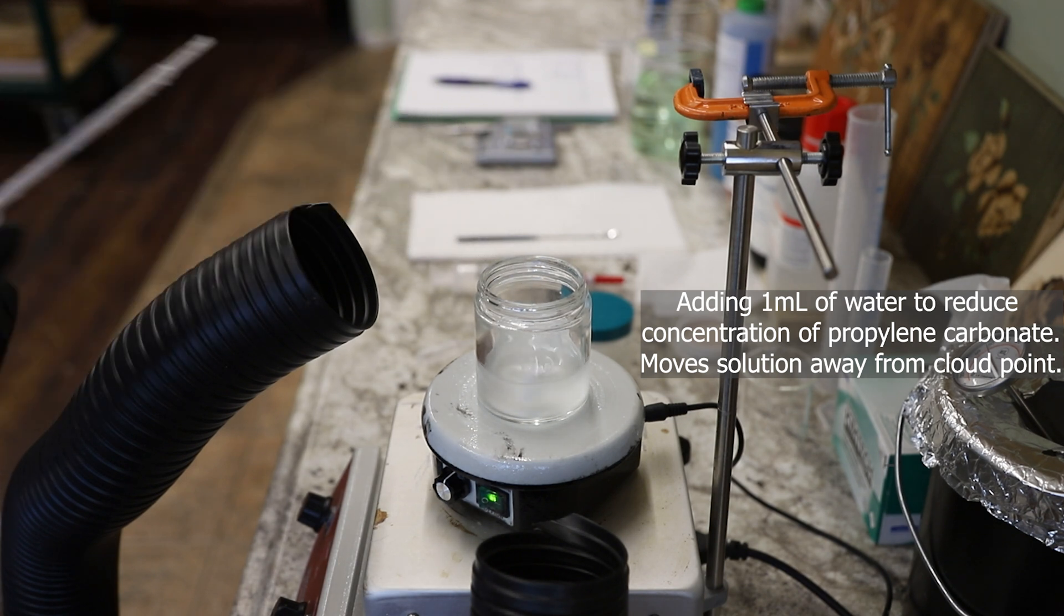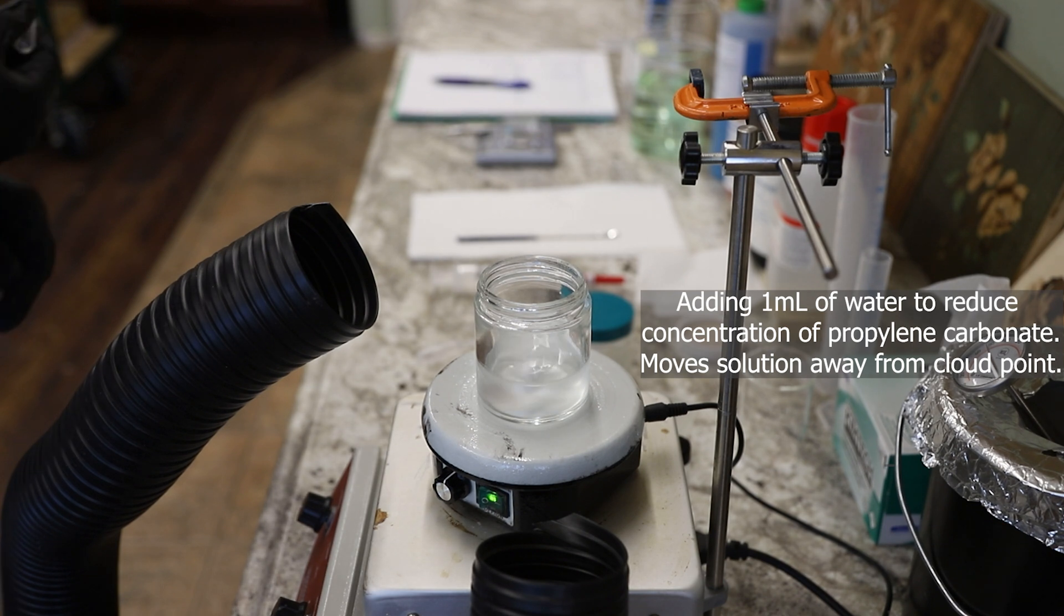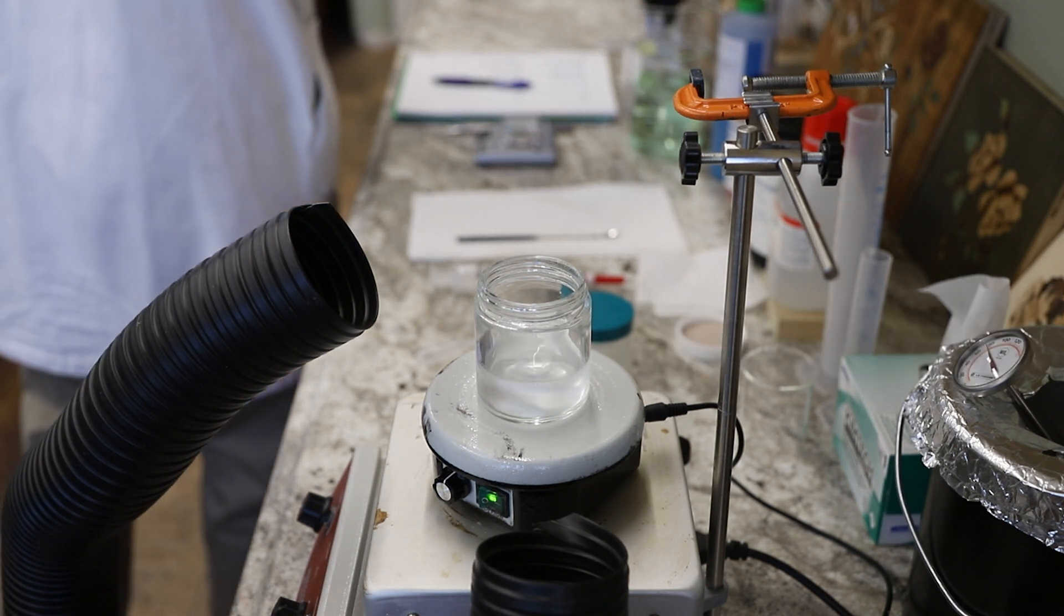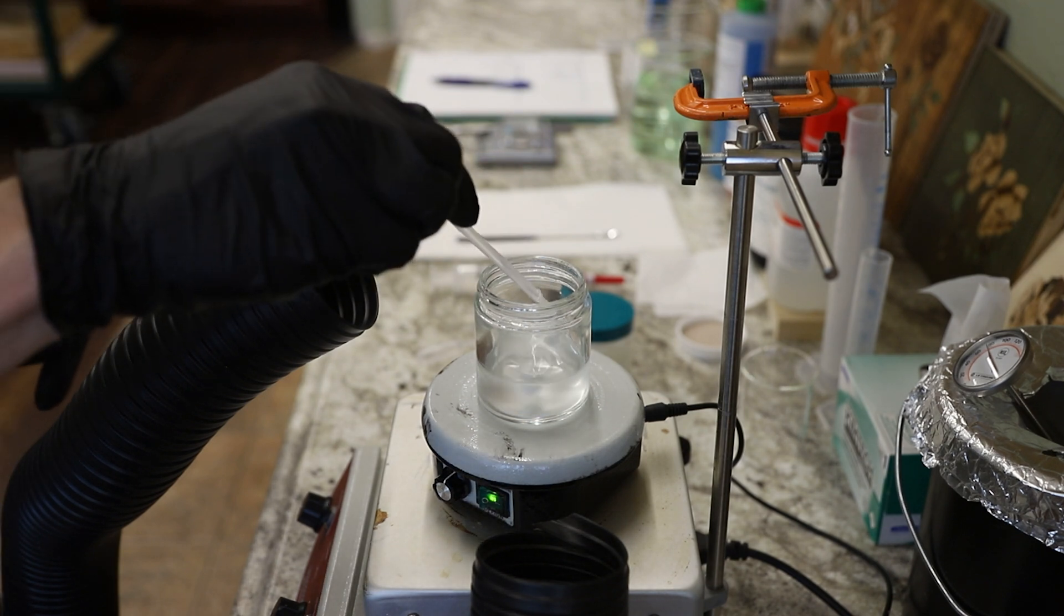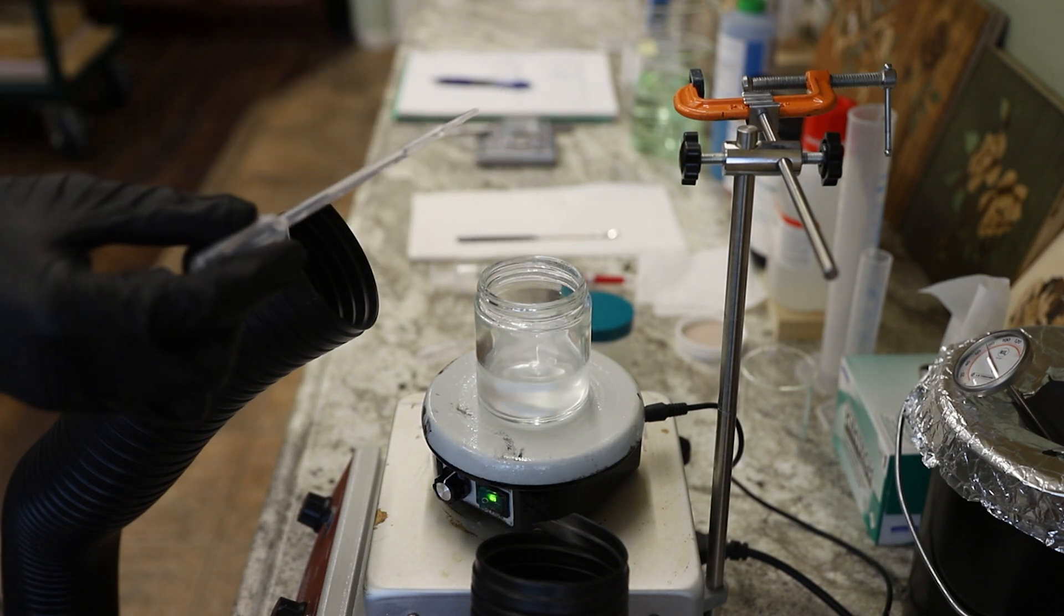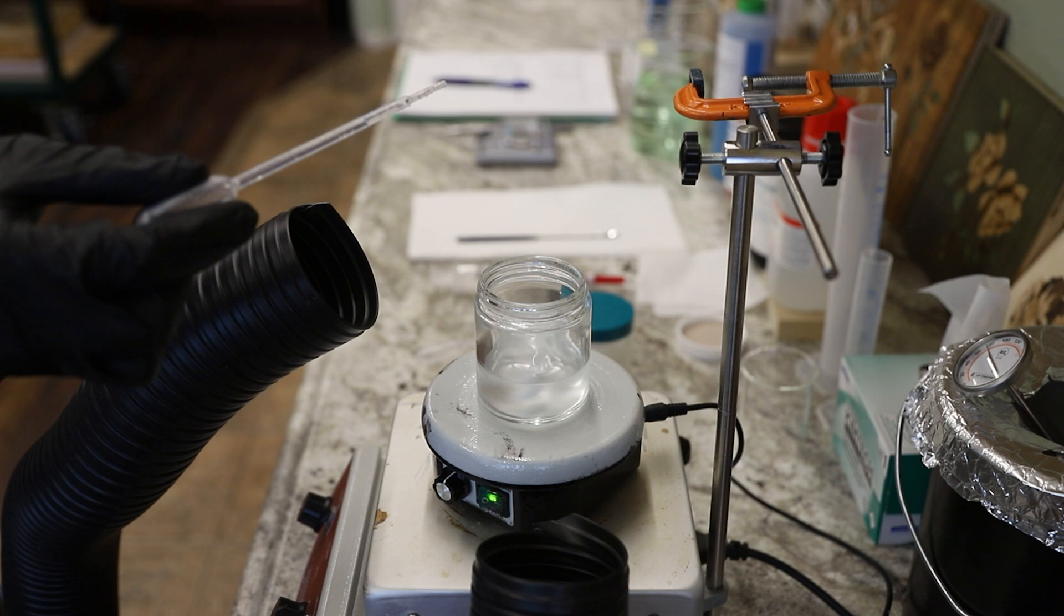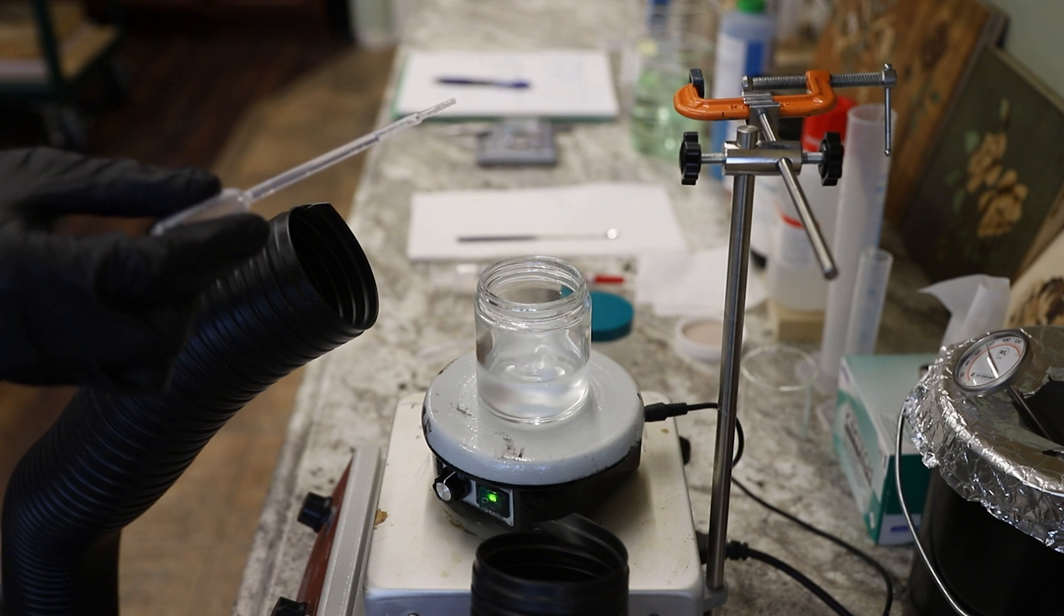So don't worry if you get to the cloud point, because you can always bring the solution back. And you do that by, in this case, just adding a little bit of water. Here I'm adding maybe 1.2 milliliters or so of water. And you can see, as soon as I do that, the solution goes right back to being transparent.